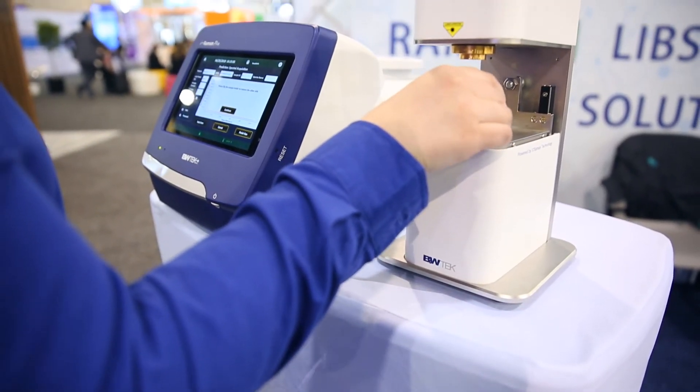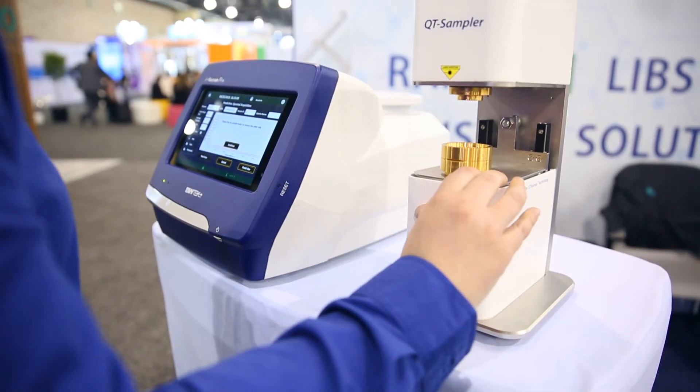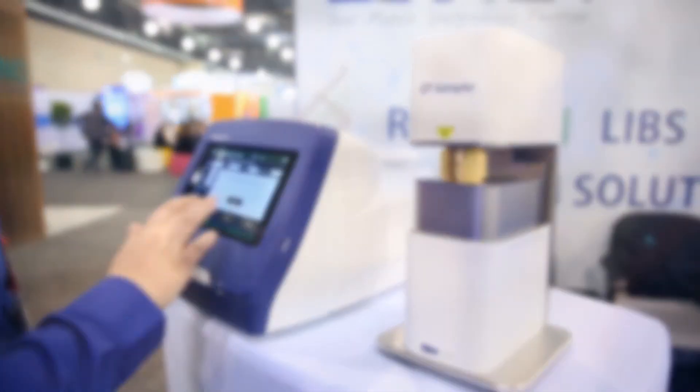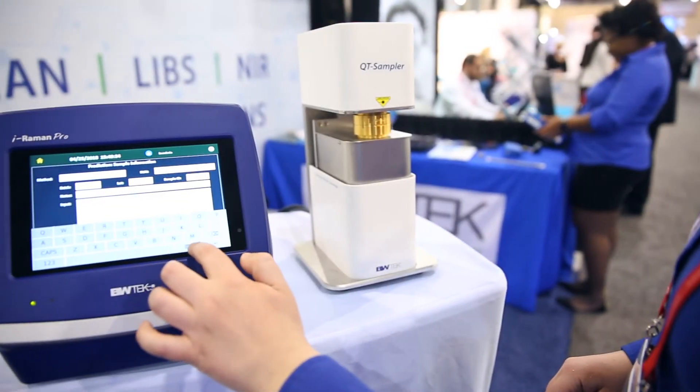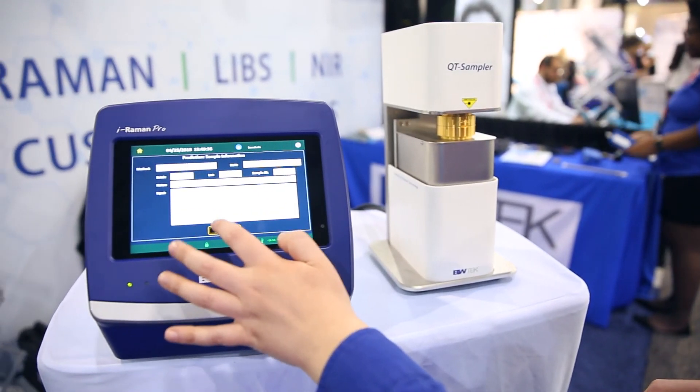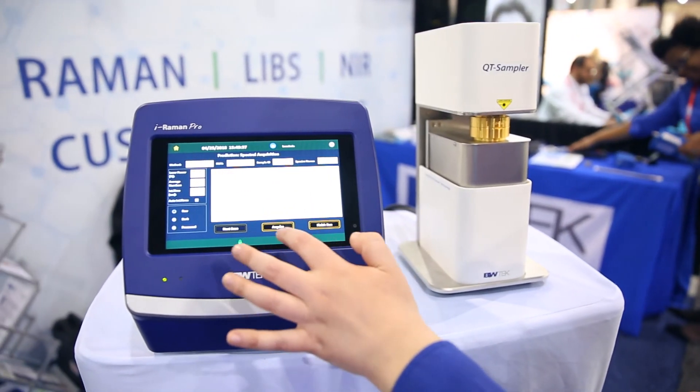There are also no consumables in this approach, so you save on that as well as the disposal costs. It scans samples within seconds rather than minutes or hours, helping save a lot of time for routine analysis.